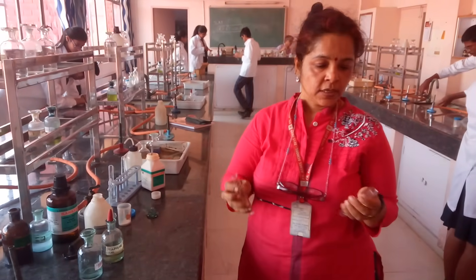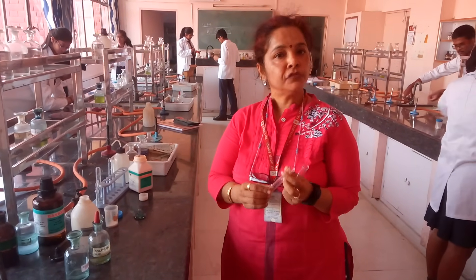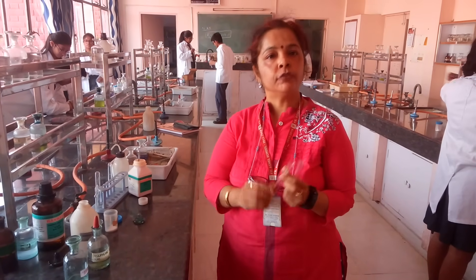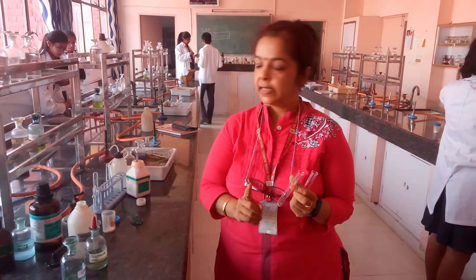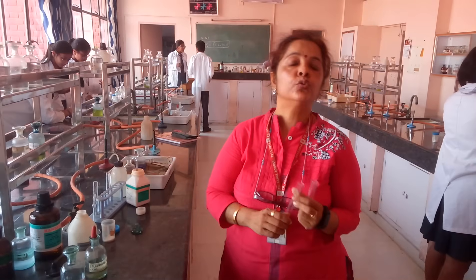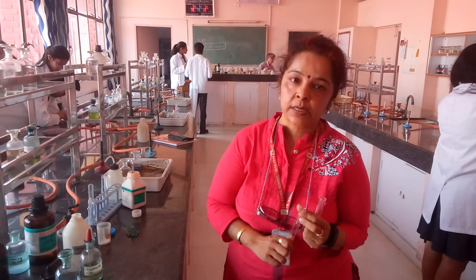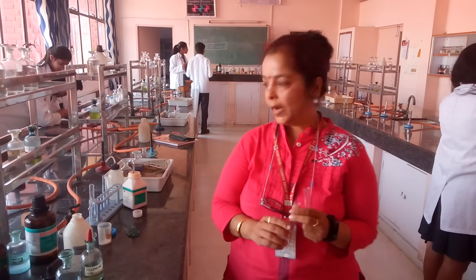Good morning students. In today's class, we will be doing a confirmatory test of chloride ions. The confirmatory test that I am going to do is the chromyl chloride test. How do we go about it?